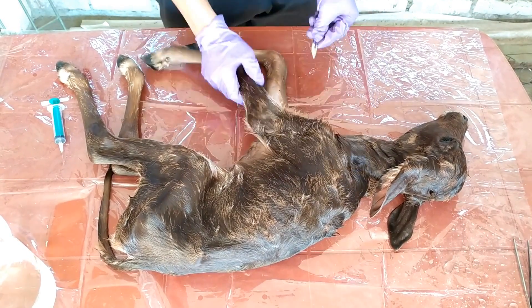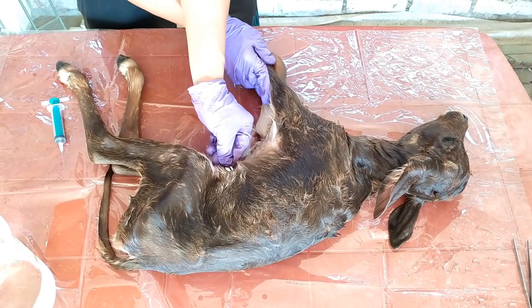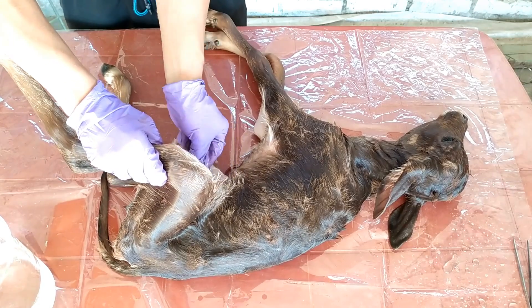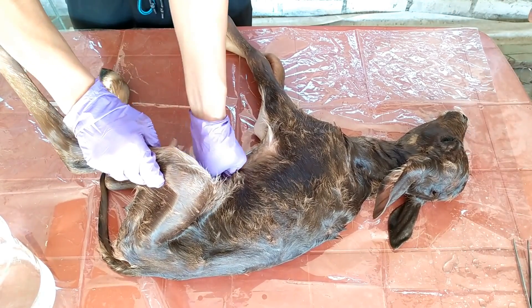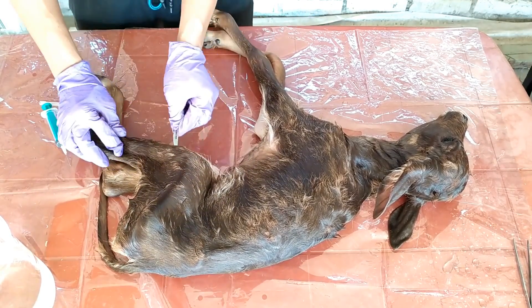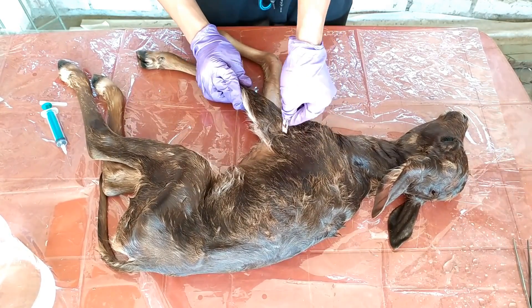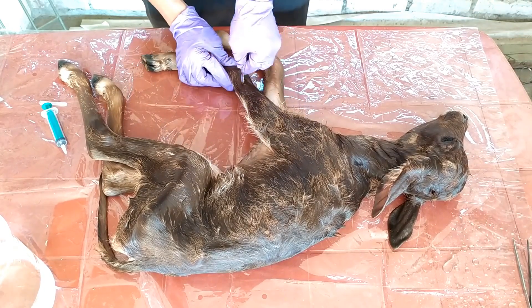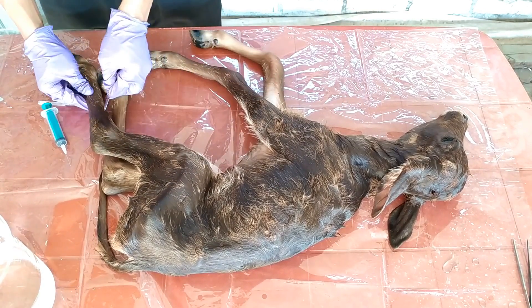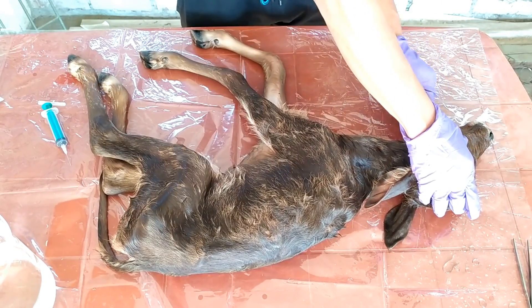Main areas of focus would be the major muscles of the limbs, the tail, neck, abdomen, and also the gaps between the ribs. The length of the slits will depend on the size of the specimen. For this calf specimen, slit lengths of half an inch or so would be appropriate. I should admit that I made a bit too many slits, which was overkill. Nevertheless, based on my past experiences when preserving very large organisms, a bit of overdoing is way better than underdoing, as dealing with putrefaction and decay in your precious specimens is not a very enjoyable experience.